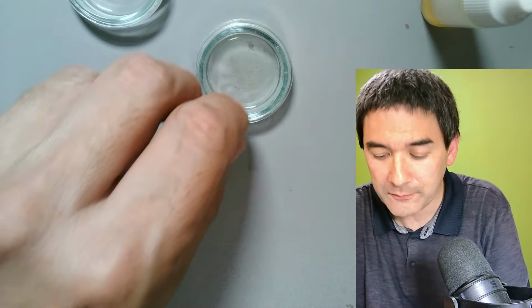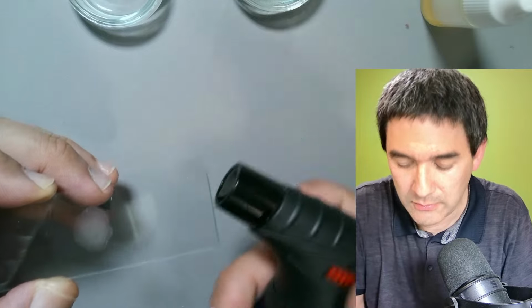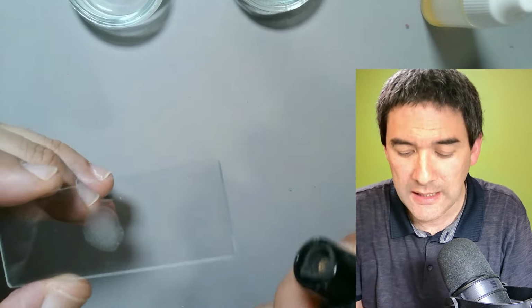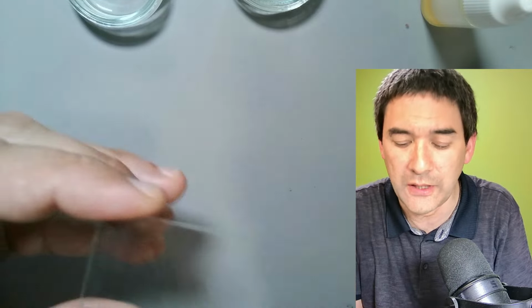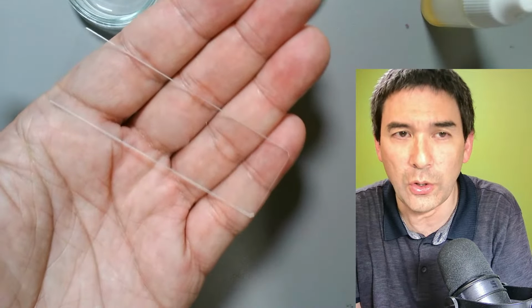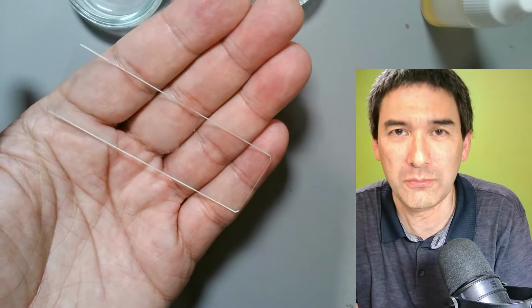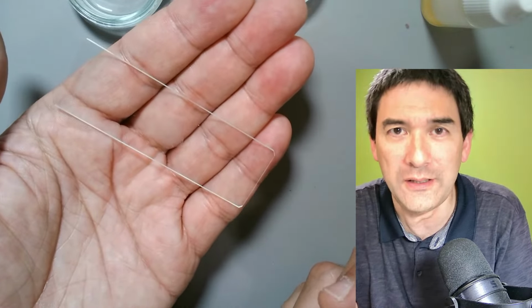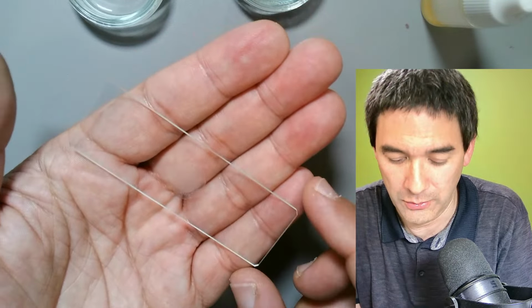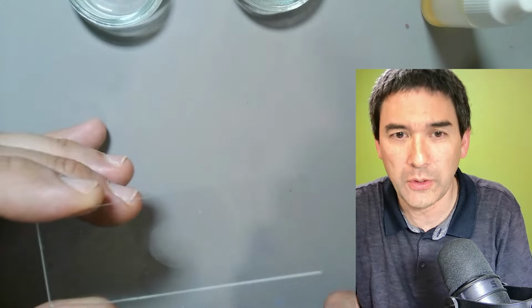I don't want that. So instead of a Bunsen burner, what I have is a little lighter here. The idea is to apply some heat, and usually you pull it through the gas flame 2 times so that you're able to hold it on your palm. It's got to be hot, but it should not burn you. The rule of thumb is it should be hot enough that you're just able to hold it without hurting or burning you. This was always the measure.